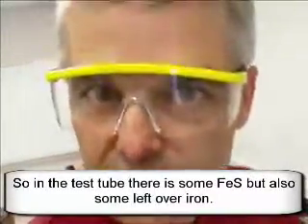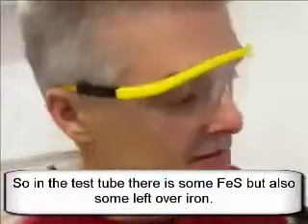It smells like I'm at Yellowstone. Yeah, well, it's because sulfur stinks. I'm going to go put this in the hood.